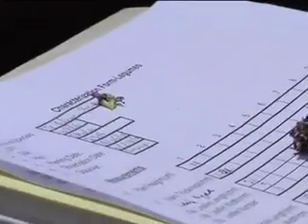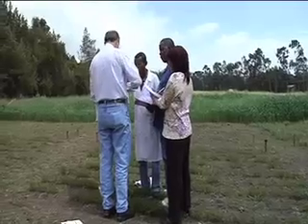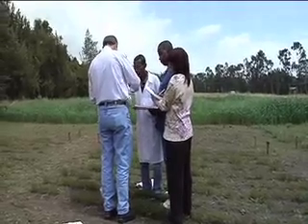The practical way to measure flower length is in the lab, because in this case you have to dissect it and take one flower to do the measurement for each flower. This flower is in a very late stage because it is podding now. For the best measurements, flowers should be measured when the plant has 50% flowering.